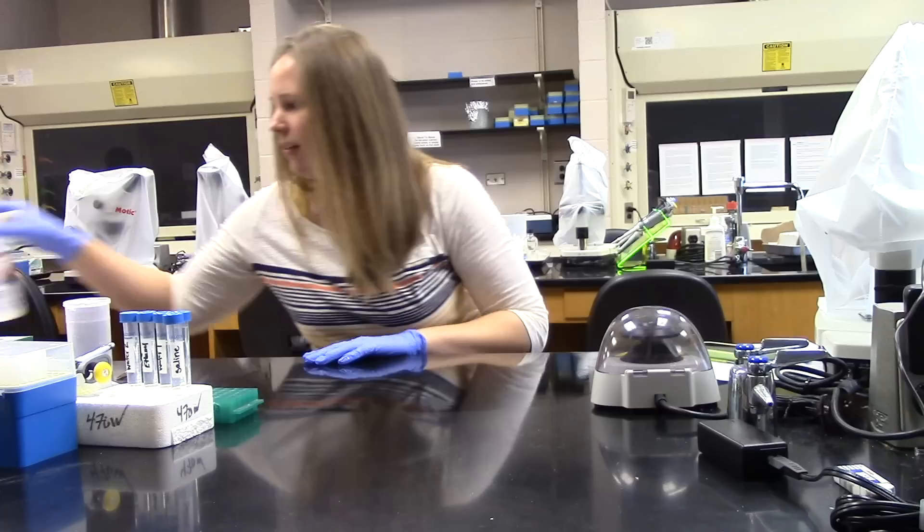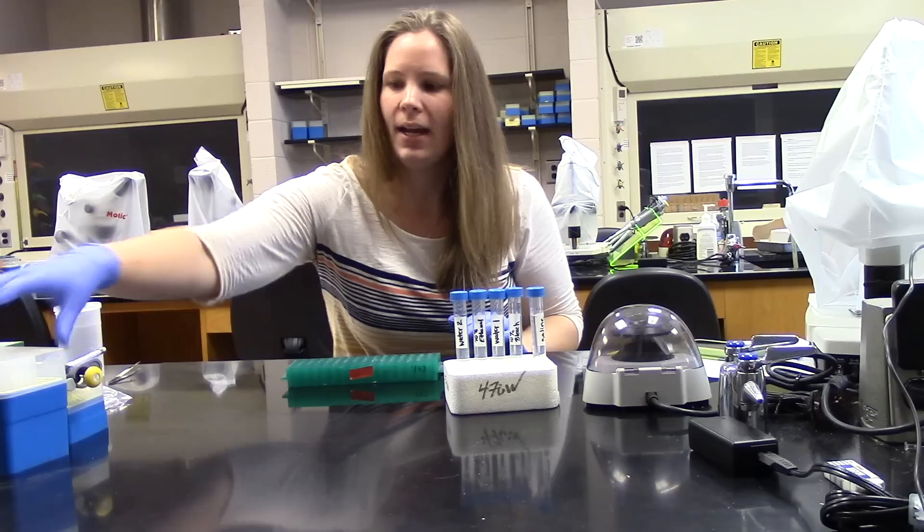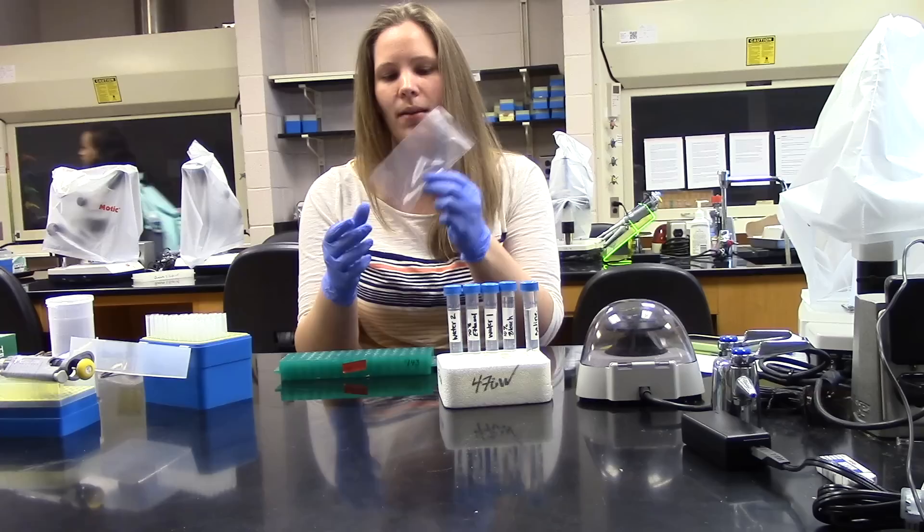The beetles are in tubes here. First, we want to prepare the tube that we will collect our beetle into. We have a mortar and pestle here, the tube.